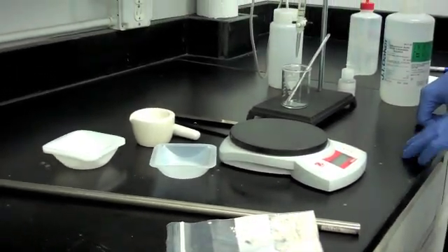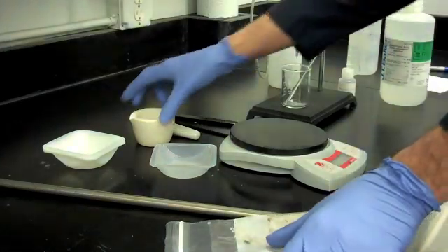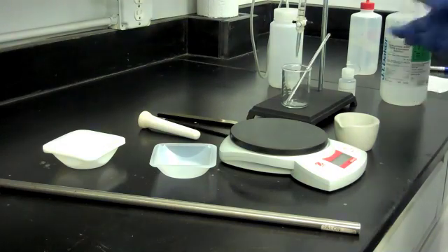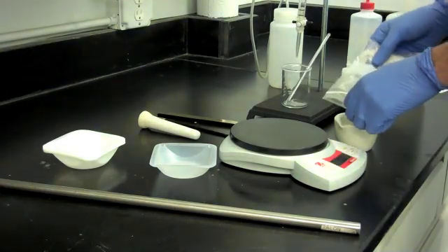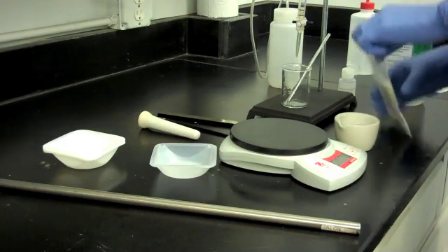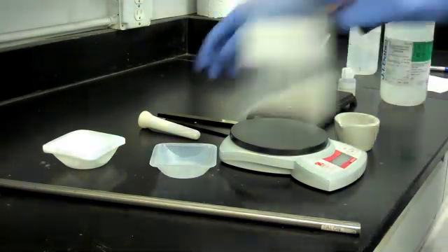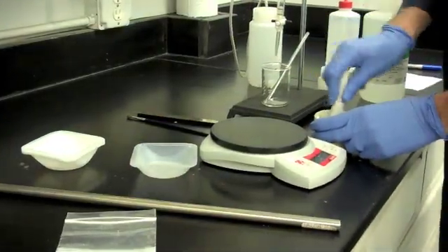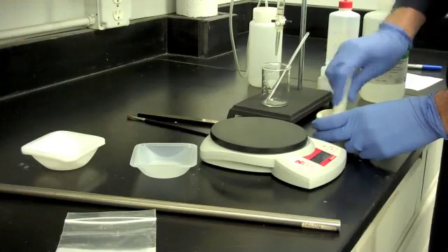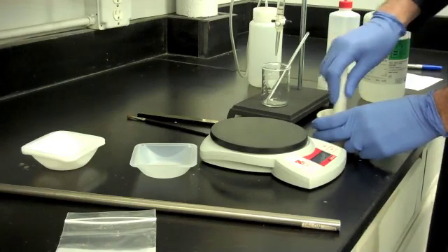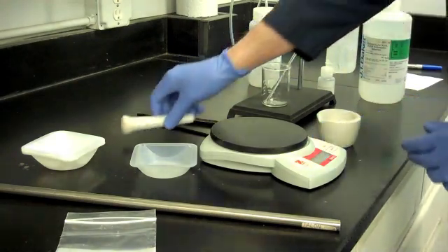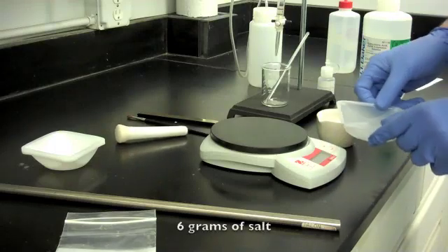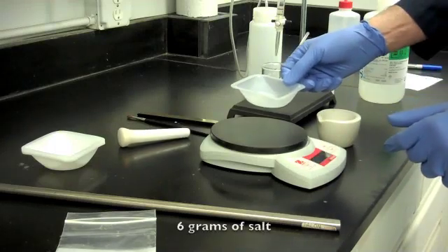Transfer the salt from the Ziploc bag into the mortar and pestle. Crush the salt into fine particles and it will make it easier to go into solution. With the use of the scale, weigh out 6 grams of the salt.